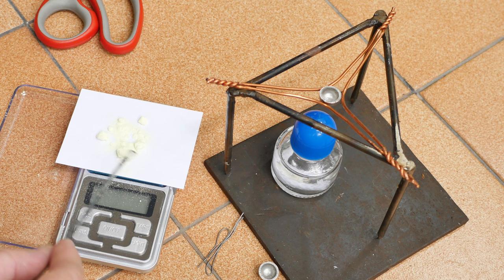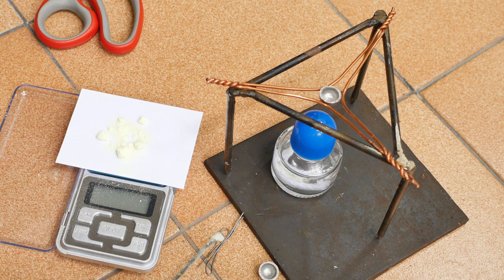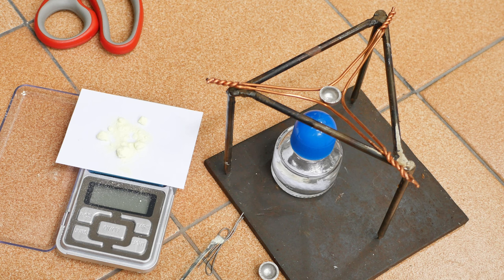And this is half a gram of sulfur. So obviously all of this is not going to fit in there. And this is obviously also not the ratio of 6.5 to 1, but as we said earlier, a lot of the sulfur is going to burn off and not have time to react with the lead. And so that's where I am right now.